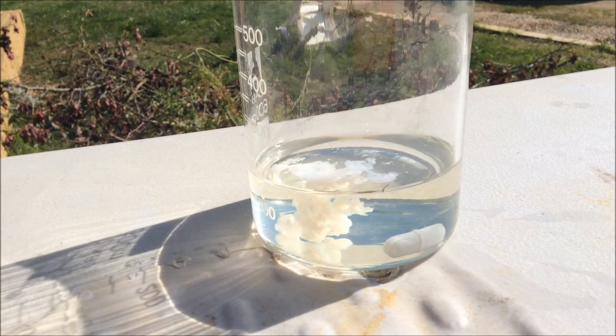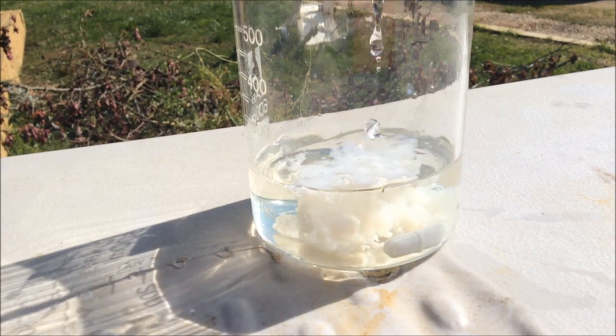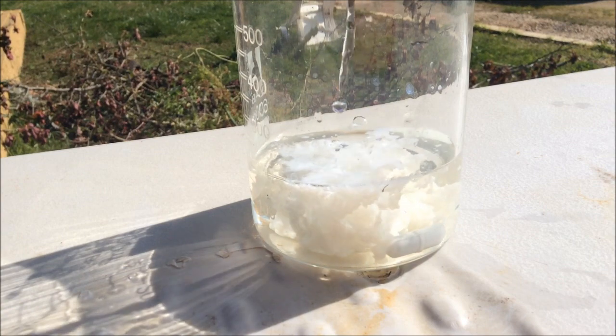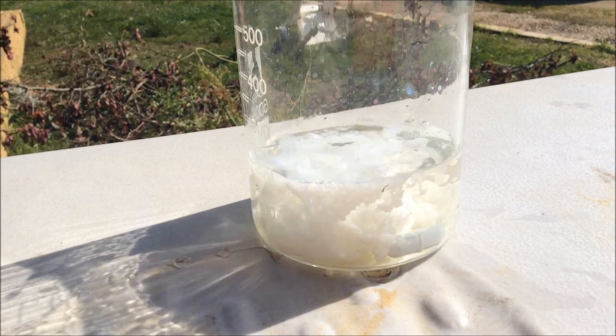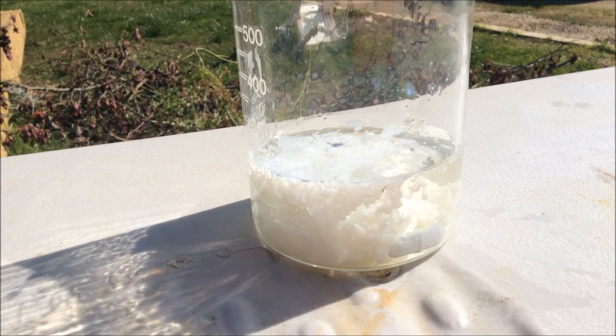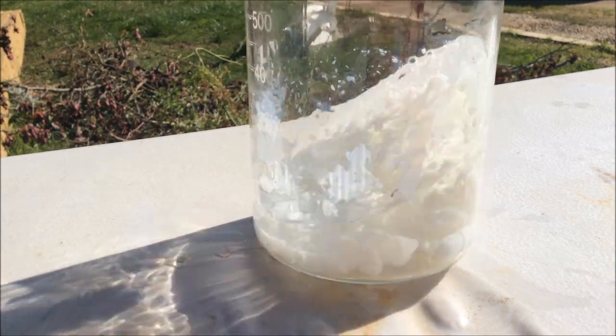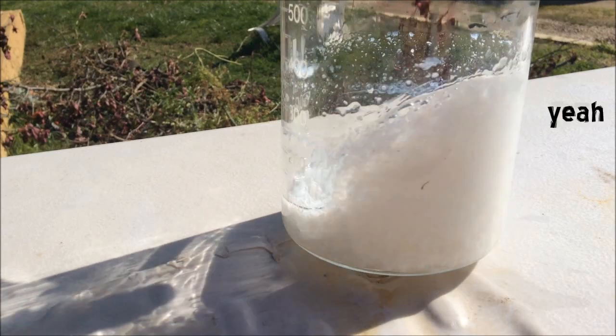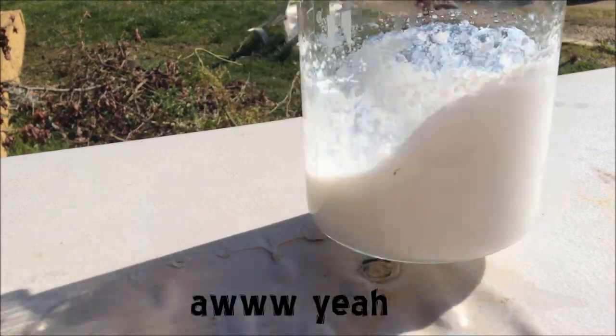And we see that we precipitate out our virtually insoluble terephthalic acid. Yeah, chunky. Oh yeah.